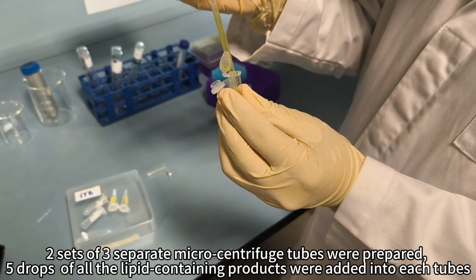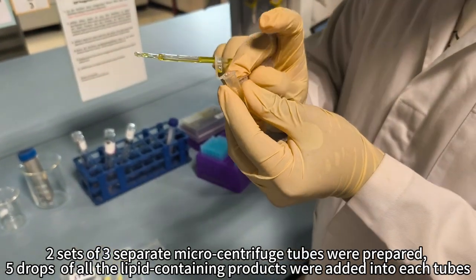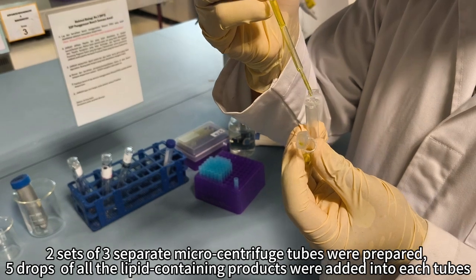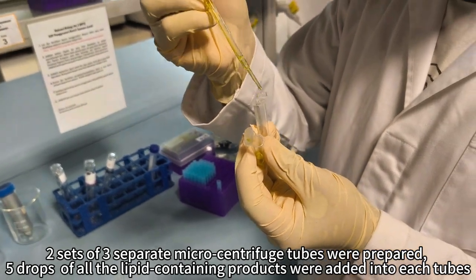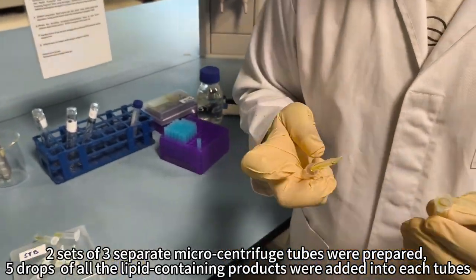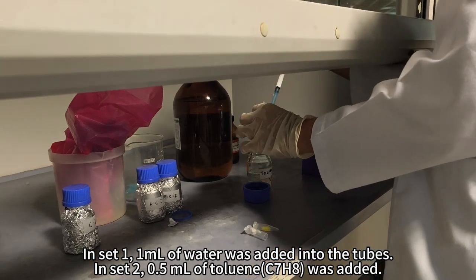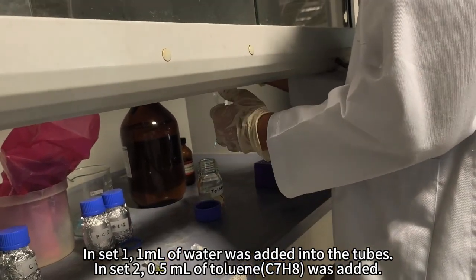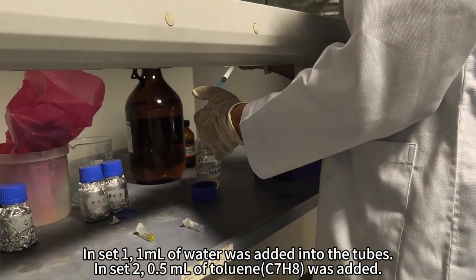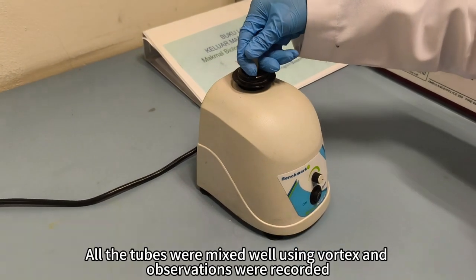Firstly, 2 sets of 3 separate microcentrifuge tubes were prepared and 5 drops of all lipid-containing products were added into each tube. In set 1, 1 ml of water was added into the tubes. In set 2, 0.5 ml of toluene was added. Lastly, all the tubes were mixed well and observations were recorded.